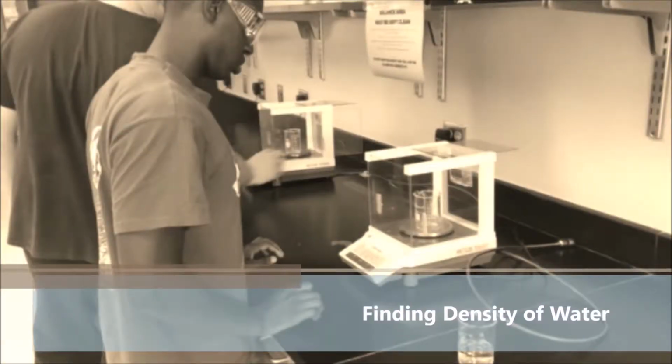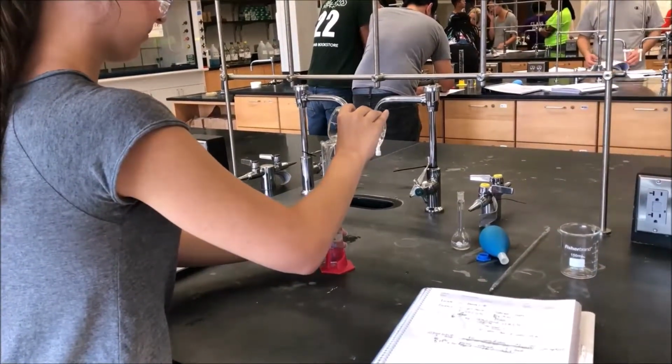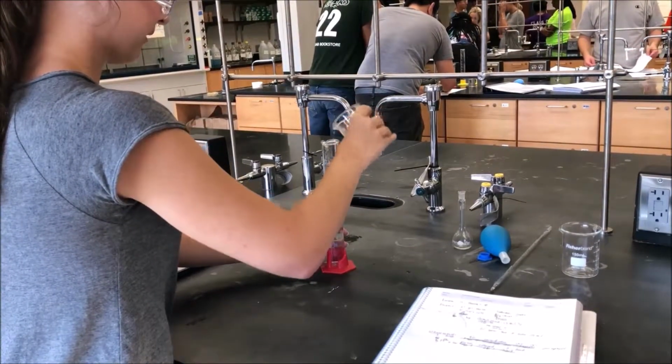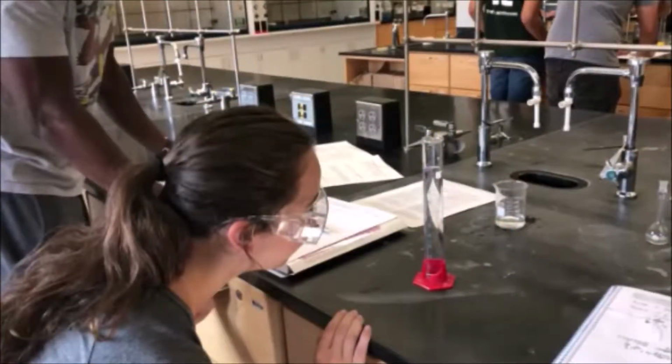As we proceed to find the density of water, we start by obtaining a beaker filled with water from the sink. We then transfer that water into a graduated cylinder. We then record the initial volume that was read at eye level with the meniscus.